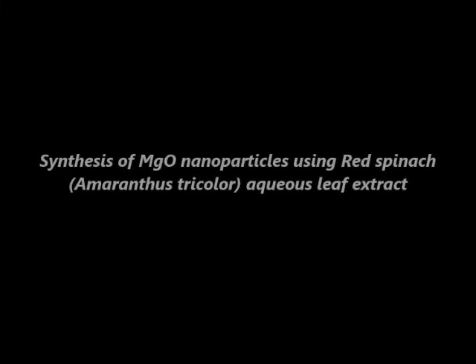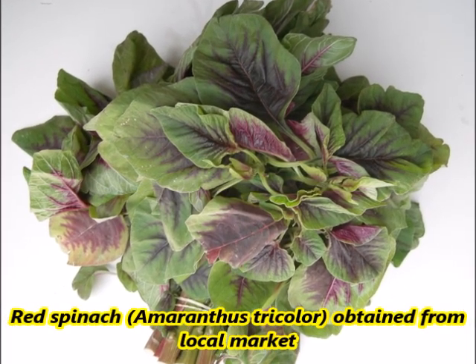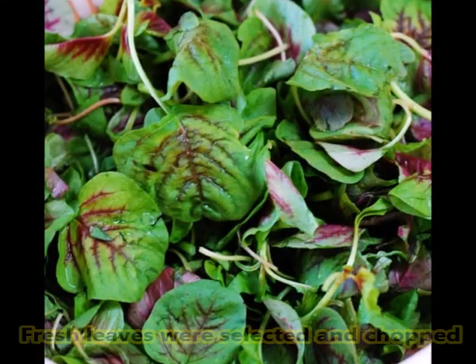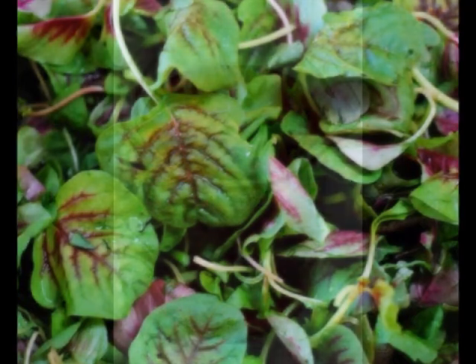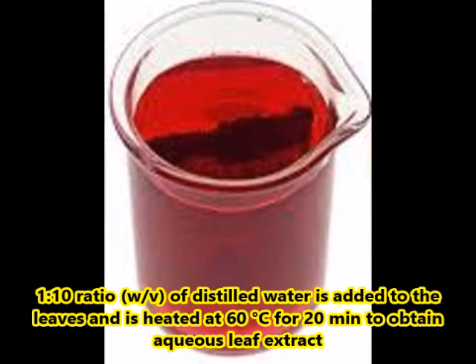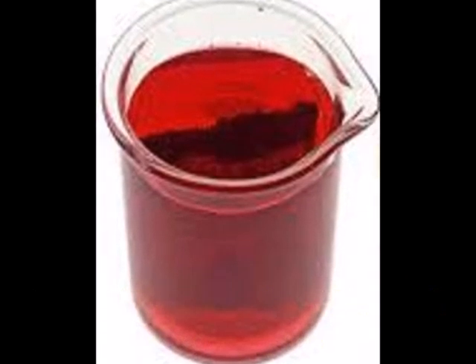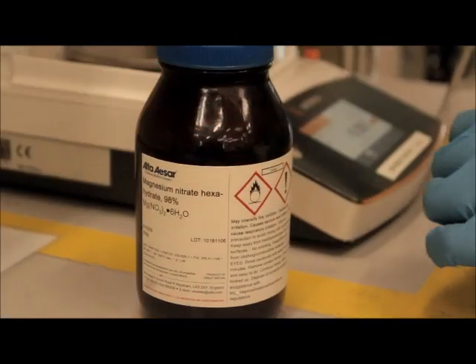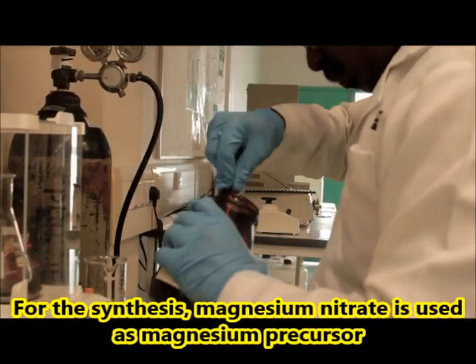Synthesis of magnesium oxide nanoparticles using red spinach aqueous leaf extract. Red spinach is obtained from the local market; fresh leaves were selected and chopped into smaller equal sizes. A 1:10 ratio of distilled water is added to the leaves and heated at an optimized temperature to obtain the aqueous leaf extract.